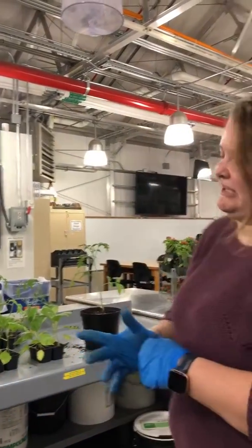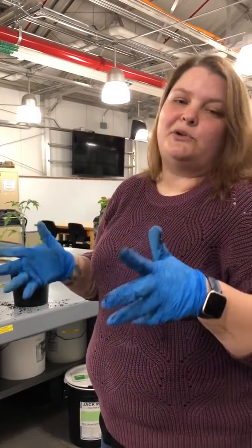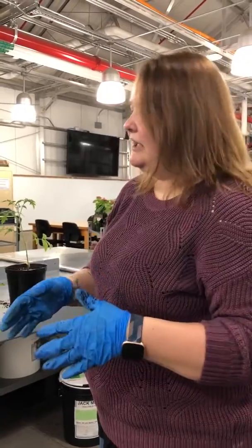Okay, so third video for plant physiology is putting in the next experiment. So this would be, let's see, experiment 6, and I called it gravitropism, and we're going to be talking about that in lecture. And there is a folder up on Moodle with articles in it too about this particular topic.